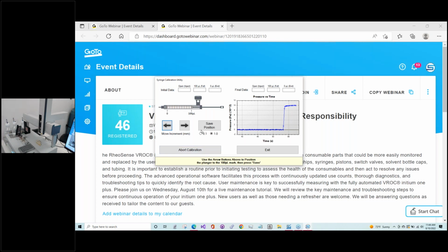I think I'm going to change to 0.1. Move it over a few times. It's still kind of far. Okay. Still have a few more. And then if you can't really tell if it's there, sometimes I'll go over that line just to see if the tip will go past it. And if I know it goes past it, then I know what I had before is usually right on the line. So I'm going to do it a few more times. And maybe once more.